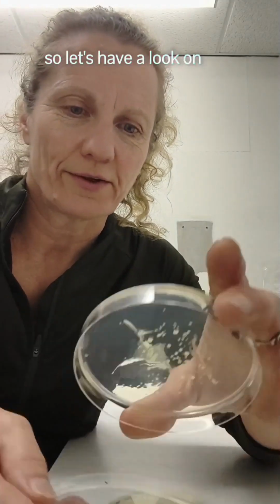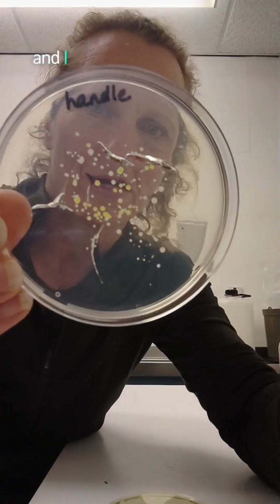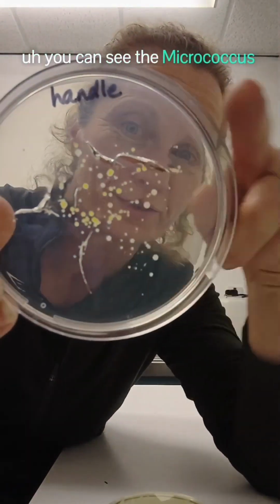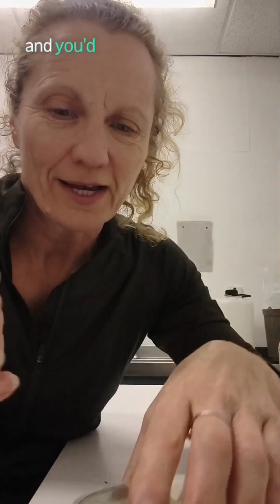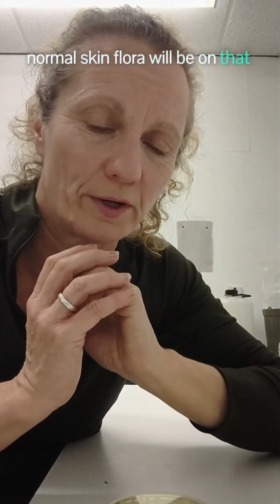So let's have a look. On this specimen, I've got some colonies. This came from a door handle of a toilet, and I can look at that and see straight away I've got Micrococcus species. You can see the Micrococcus luteus one. I'm pretty sure that's what that is. And then I've got some Staphylococcus as well. And you'd expect that on a door handle where people have touched it. Normal skin flora will be on that door handle.